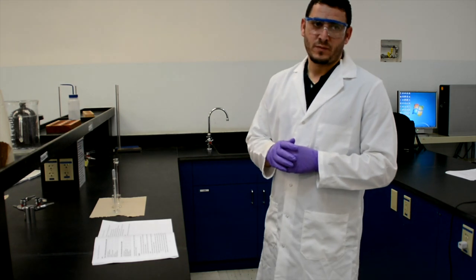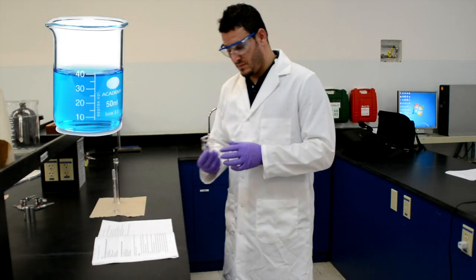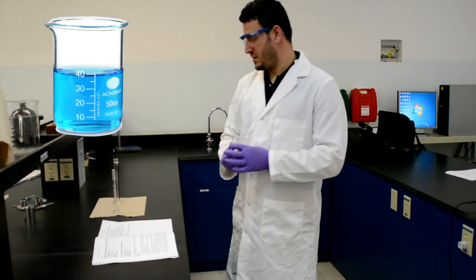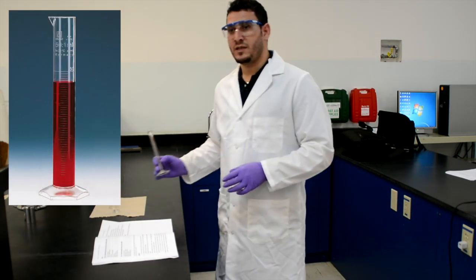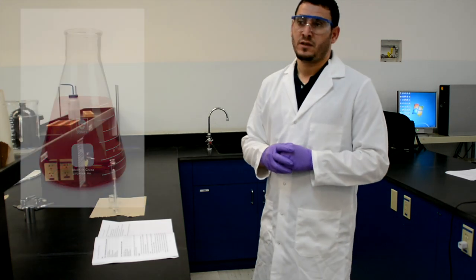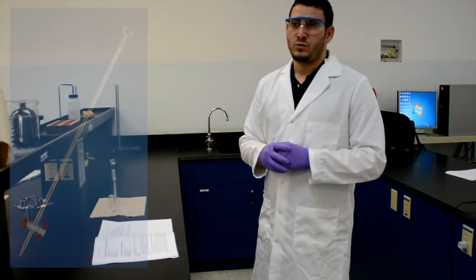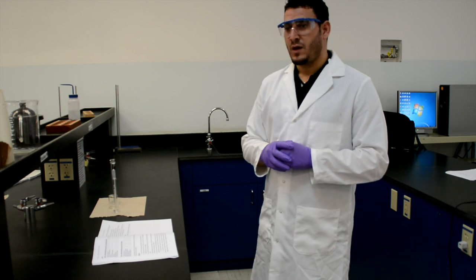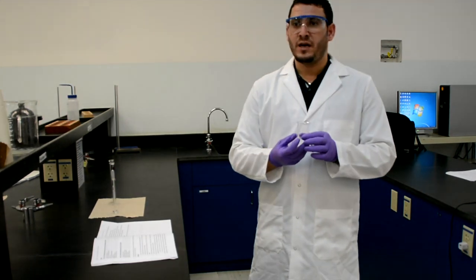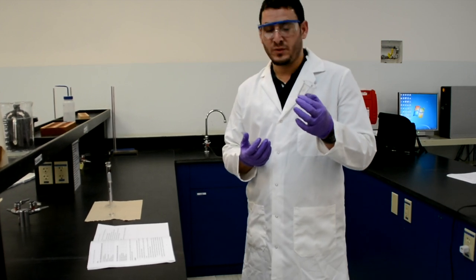To measure the volume in a chemistry lab you can use many different glassware, such as a beaker — that's how it looks — a graduated cylinder, and then we have other glassware like an Erlenmeyer flask and a burette.